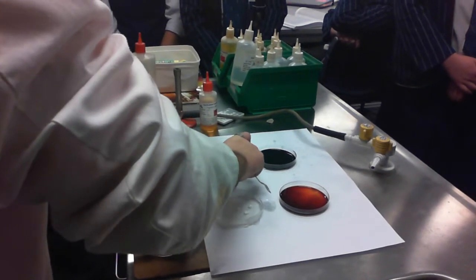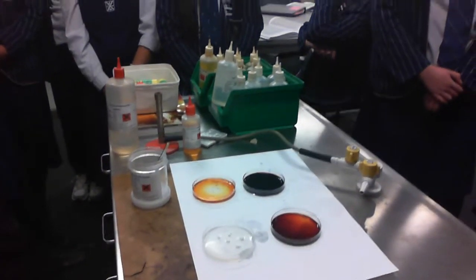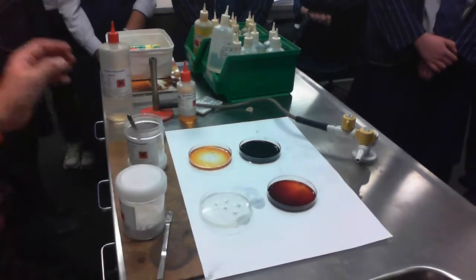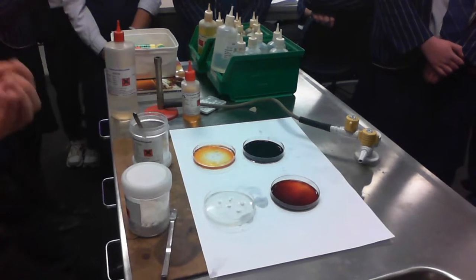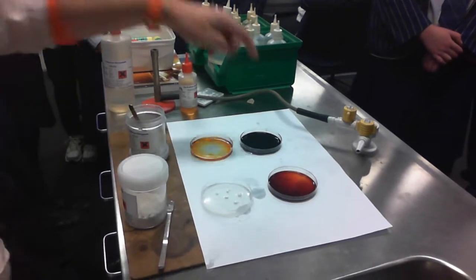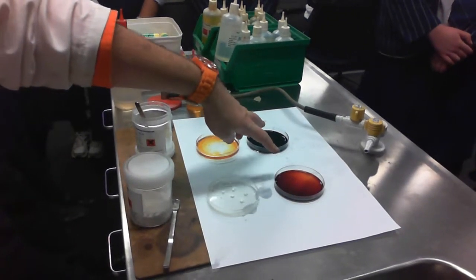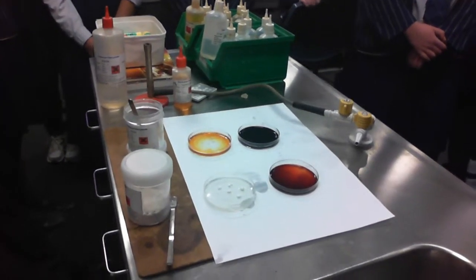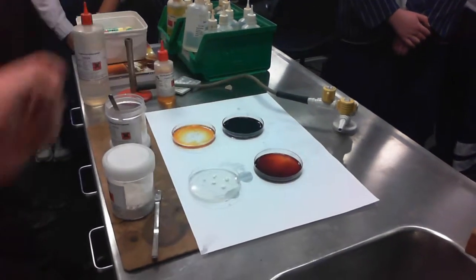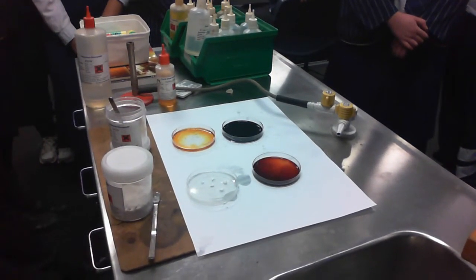Okay, so you can see there that this is using up a lot of it, but not all of it, because it's still got a little bit of an orangey, reddy colour to it. So if we change the concentration of any of our species or our reagents, then that's going to have an effect on the equilibrium position. If we add one of the reagents, it favours the forward reaction to make more products and create a new equilibrium. If we destroy or get rid of a little bit of a reagent, so lower its concentration effectively, it'll favour the reverse reaction. And that's the main thing that we want to get out of this equilibrium.